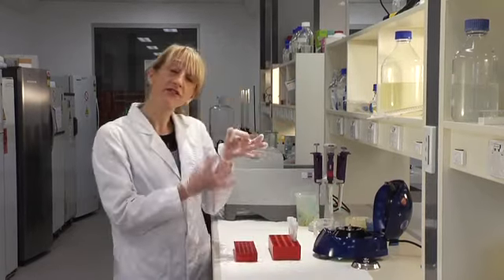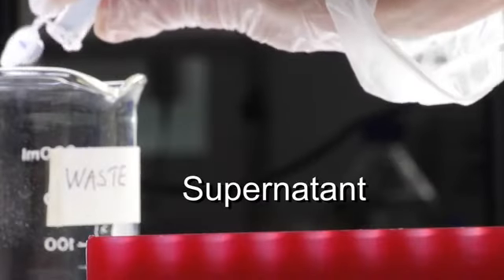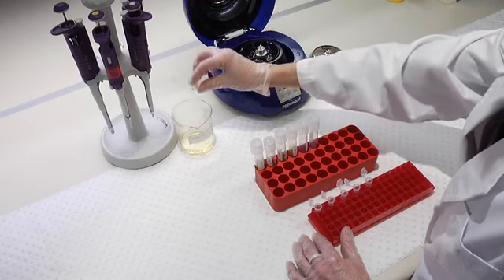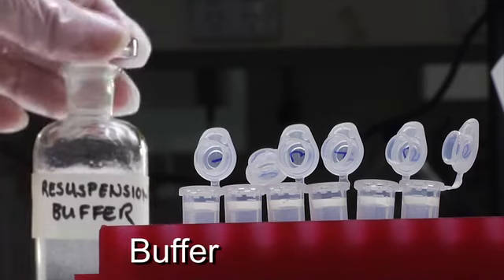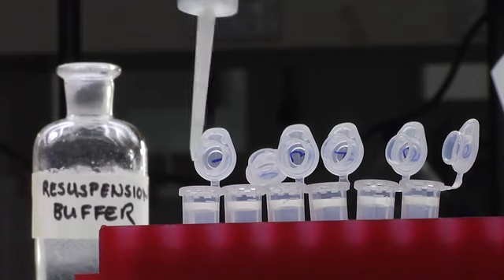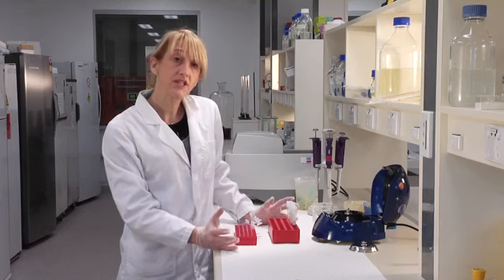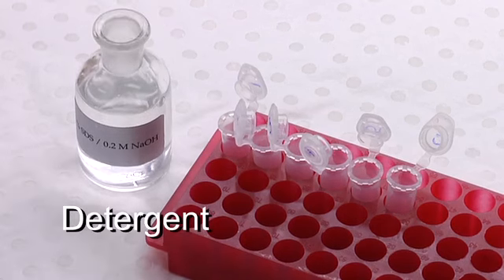Now our bacterial cells have formed a pellet, we can throw away the culture supernatant. We then resuspend each bacterial pellet in a consistent volume of buffer.